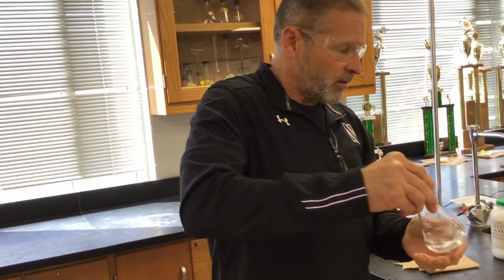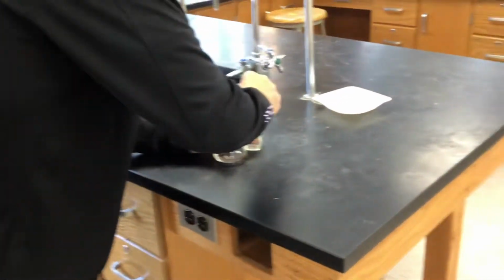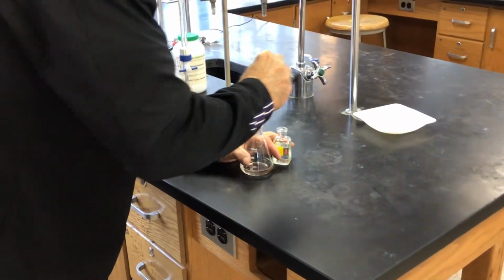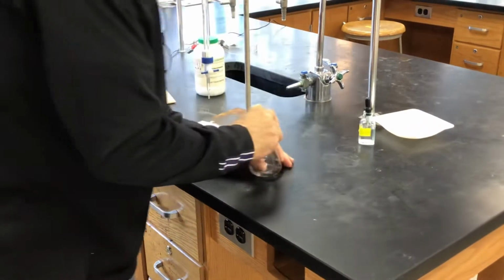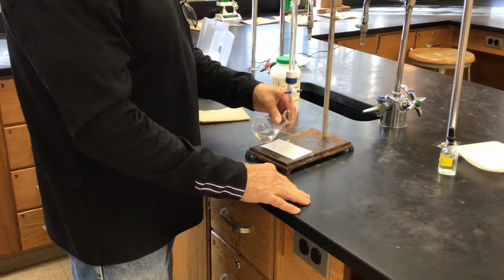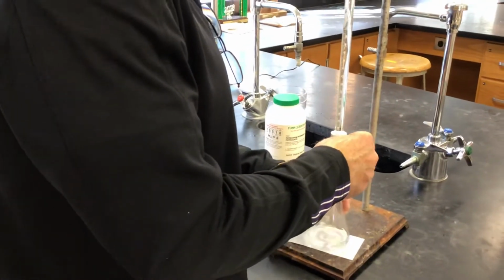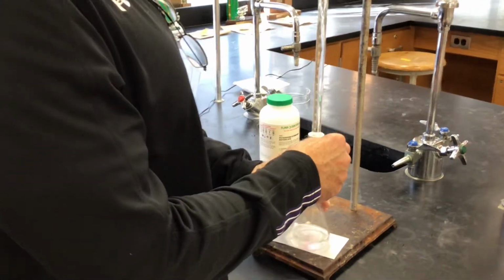Okay, that looks good. I've looked at it already. It's fine. Here we go. Phenolphthalein. All right, so you said about 3.5-ish, right? I've forgotten already. I think it was about that.